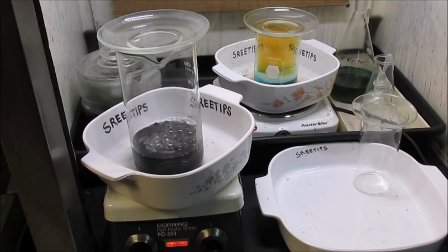The black powders have been boiling in hydrochloric acid now for about 15 minutes. I turned the heat up to high, and as you can see, I got a nice rolling boil going. We'll just let this go for about another 45 minutes, and then turn it off and let it settle.